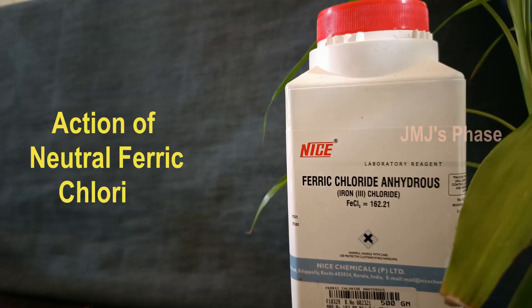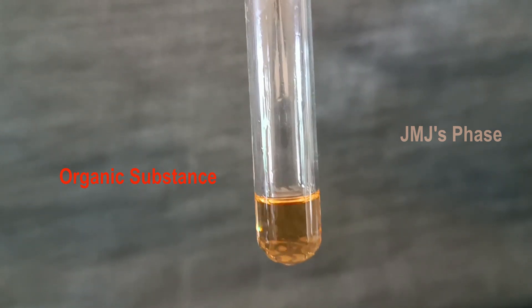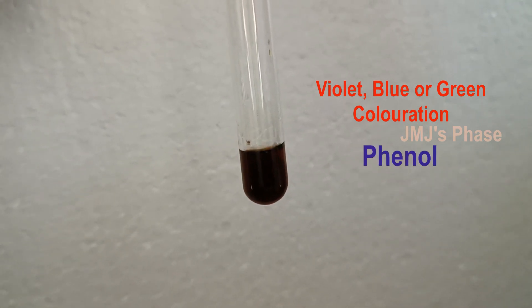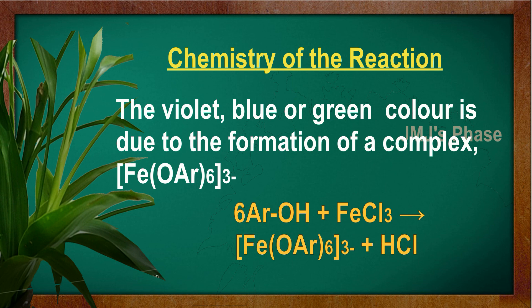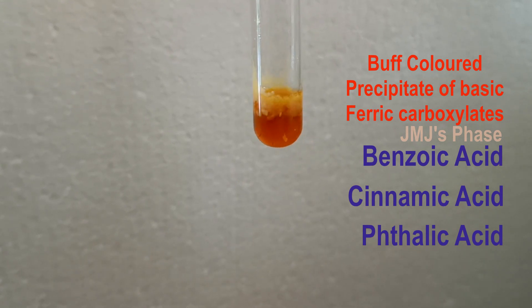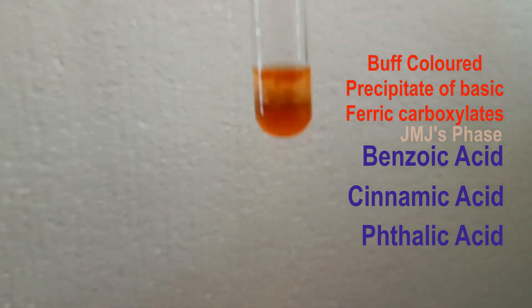Action of neutral ferric chloride: Take a little of the substance in a test tube and dissolve it in alcohol. One drop of this solution is added to about 2 ml of neutral ferric chloride solution. Violet, blue, or green coloration indicates that the compound is a phenol, and the color is due to the formation of a complex. Benzoic acid, cinnamic acid, phthalic acid, etc., give a buff-colored precipitate of basic ferric carboxylates on reaction with neutral ferric chloride solution.